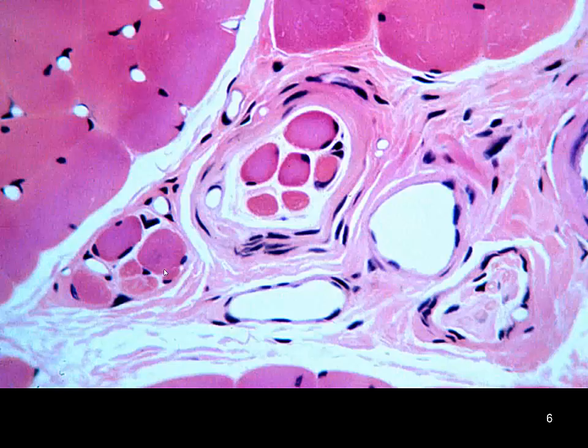Now, other things we're going to see in these cross sections, not necessarily in that same grouping as we saw here. We can see some, again, cross sections of skeletal muscle. We have the capillaries. We're really hard pressed to see the endomysium of these. Then we get to this connective tissue. It's outside of the muscle fibers themselves, and this is probably going to be our perimysium because we don't see a surface. Here's more muscle cells, and likely over here we've got some blood vessels.